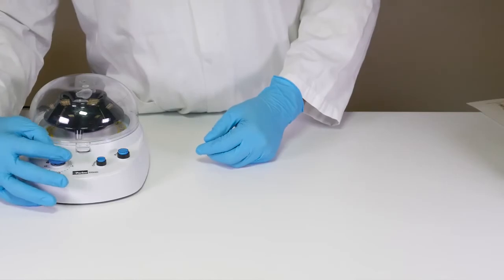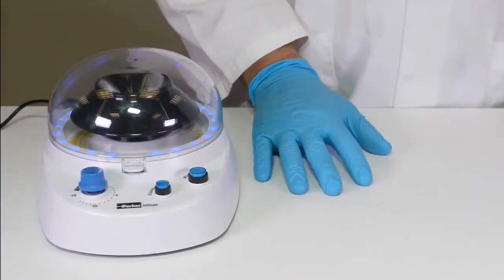Spin the tubes for 15 minutes, pushing down the timer dial to start the process.